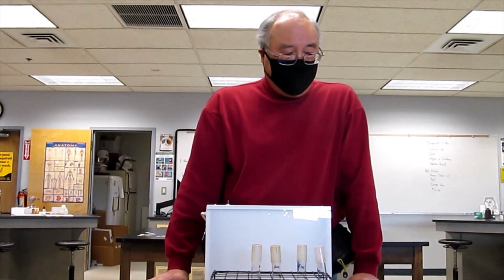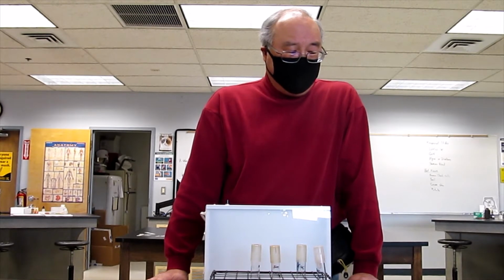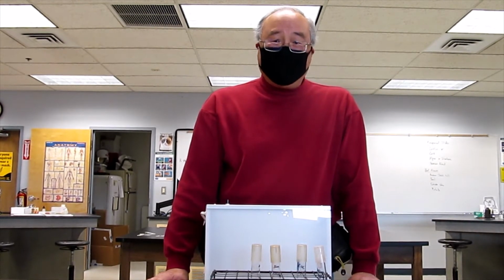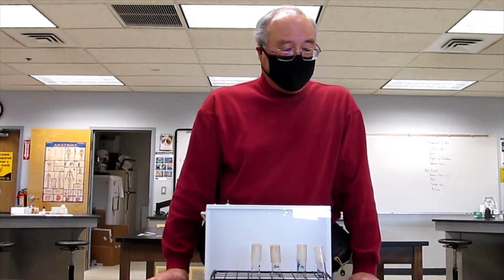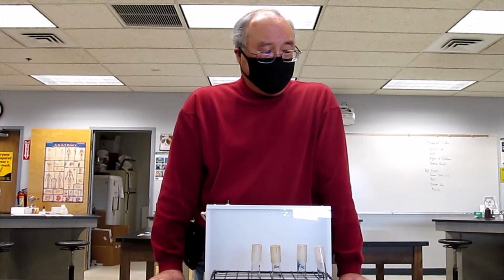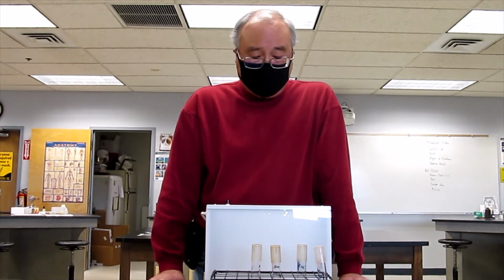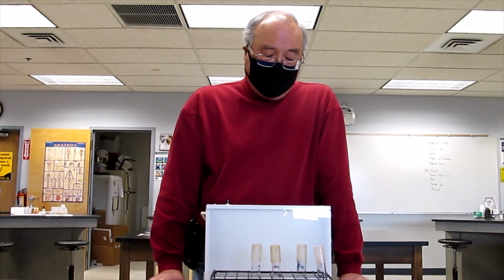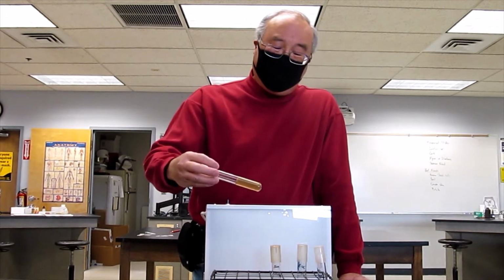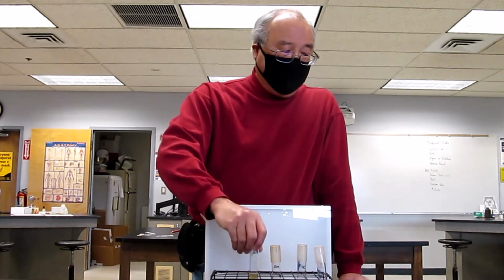Inside the media is like a digested protein, peptone. There's some ferrous ammonium sulfate, animal tissue that's digested by enzyme, and sodium thiosulfate. And there's also agar to thicken it, and it's a pH of 7.3.